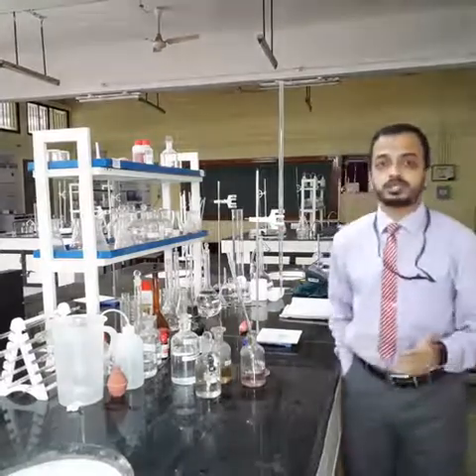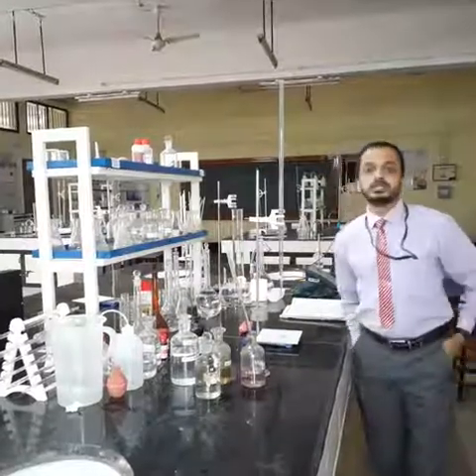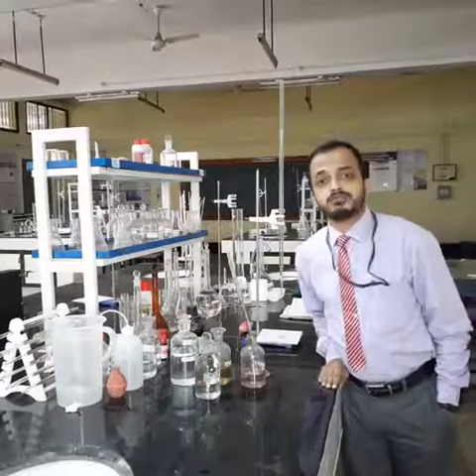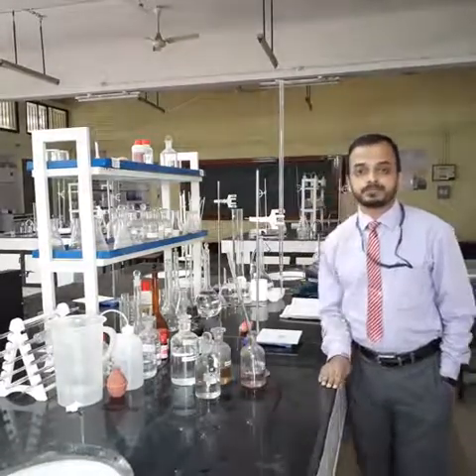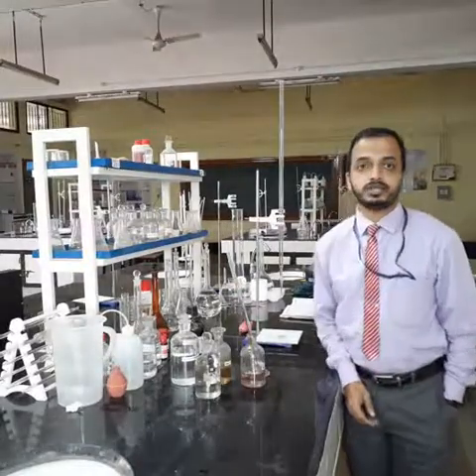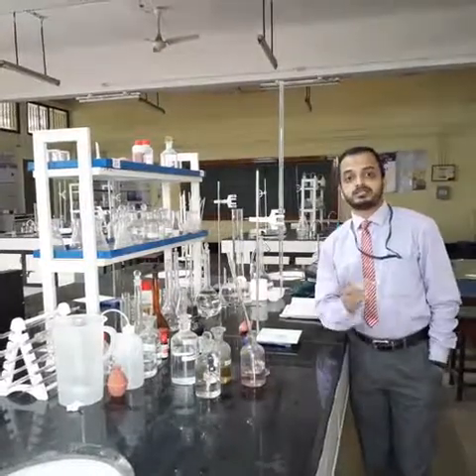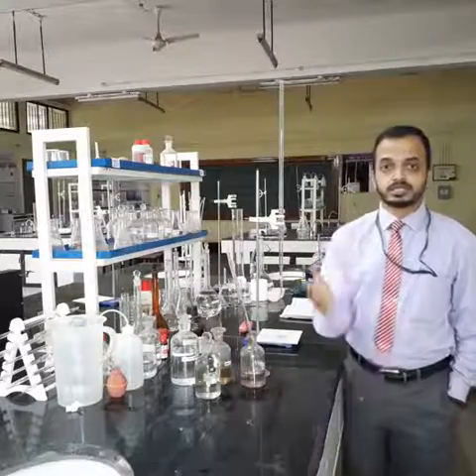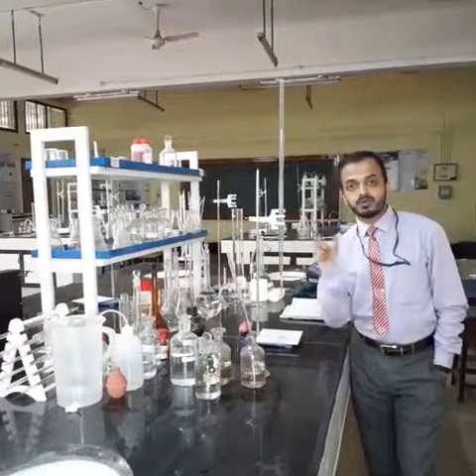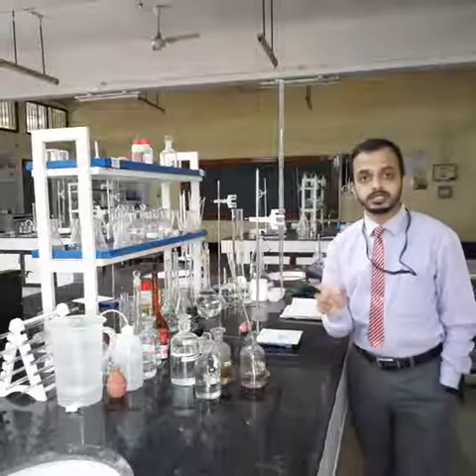Now you need to understand what should be the quantity of dissolved oxygen present in the sewage or water sample. Usually the dissolved oxygen should have a minimum value of 4 mg per liter, and the acceptable limit for domestic use is in the range of 4 mg per liter to 8 mg per liter. If it is less than that, then we say that the water is not good for consumption. In case of sewage, as the DO value reaches 0, we say that the sewage has reached a septic condition.